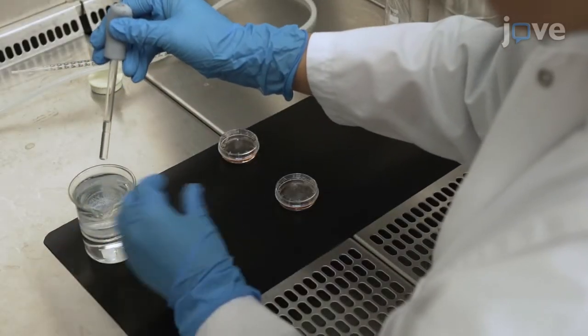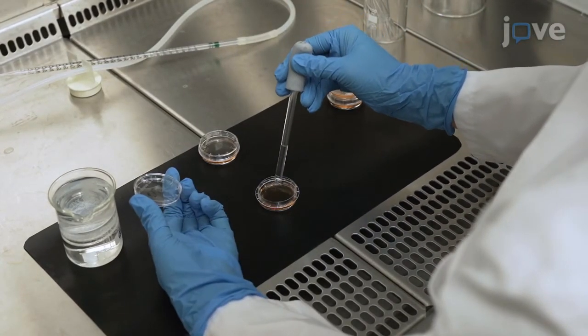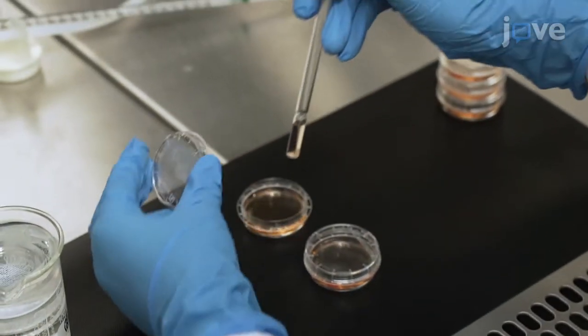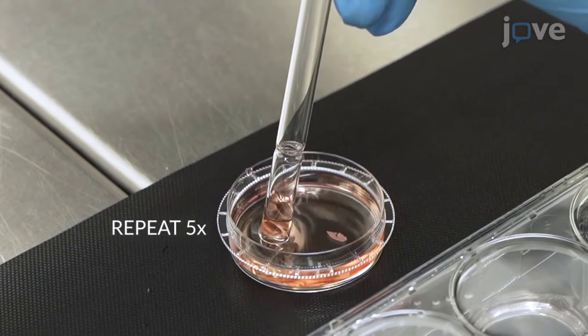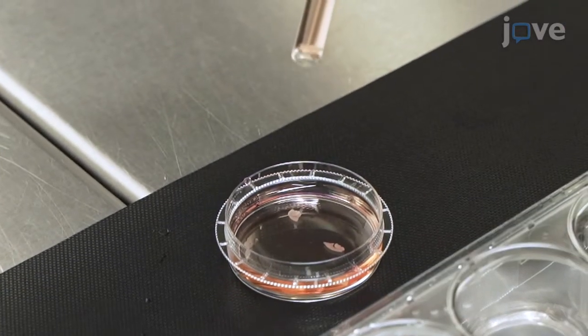With an inverted sterile glass Pasteur pipette, gently transfer the slices from the ACSF into one of the pre-warmed petri dishes filled with sterile Hanks salt solution. Change the pipette and transfer the slices to the second culture dish. Repeat the process 5 times overall. Transfer as little HBSS as possible to the following culture plates.